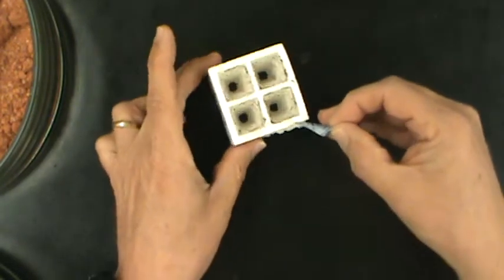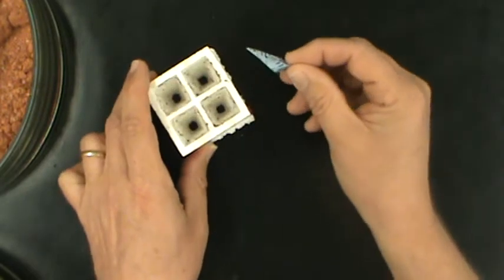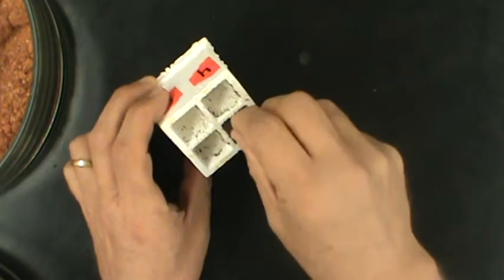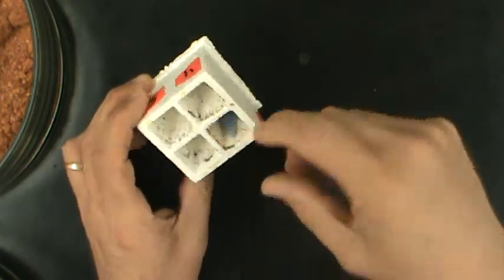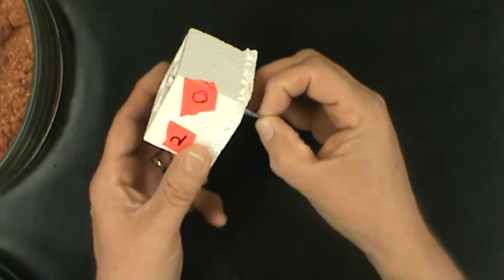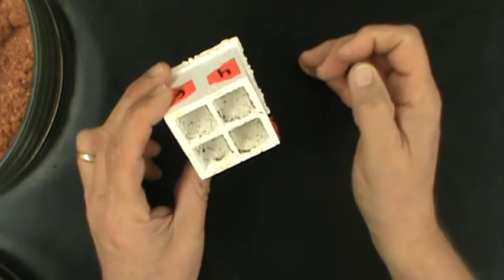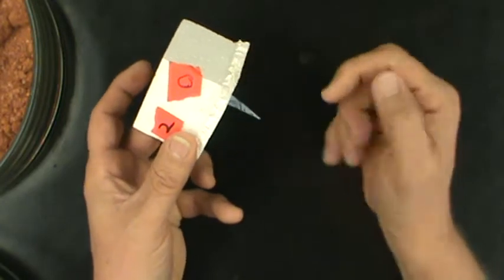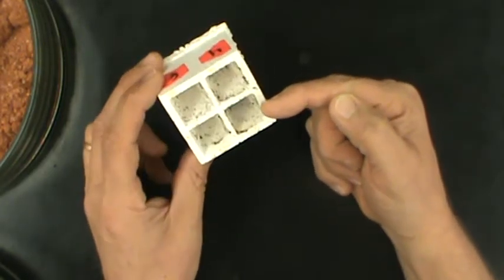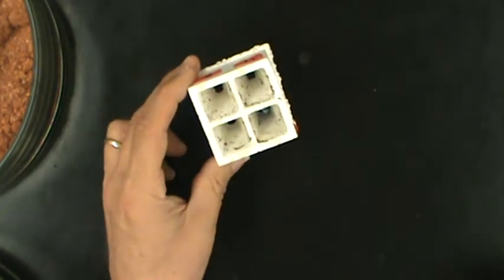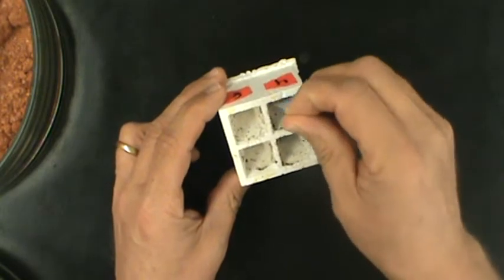Before you do anything, you need to take the quad and this, which is called a wick, and stick it down into the bottom of the quad and pull it out about halfway. This will allow water to get up into your seeds and will also keep soil from falling out of the bottom of the quad.